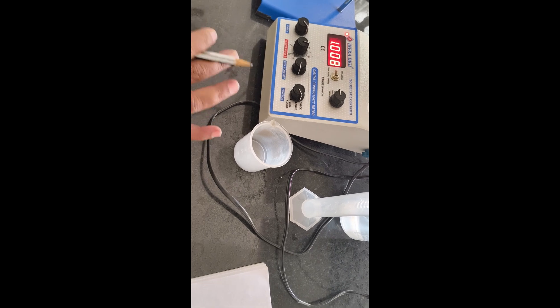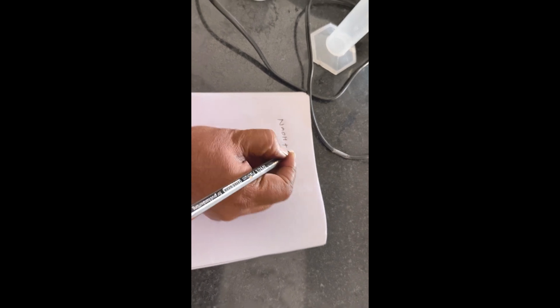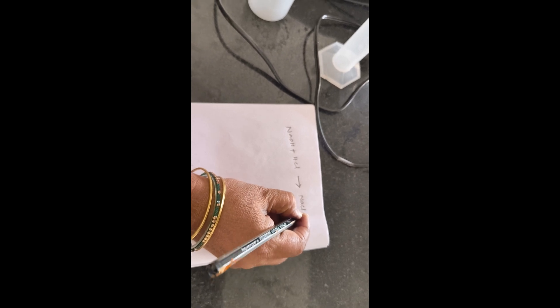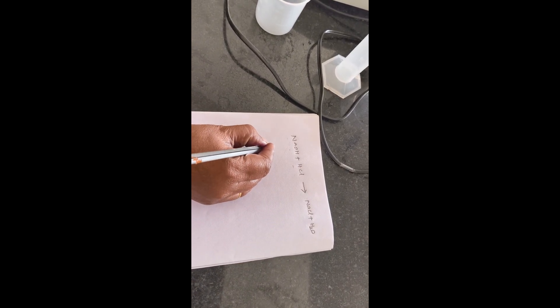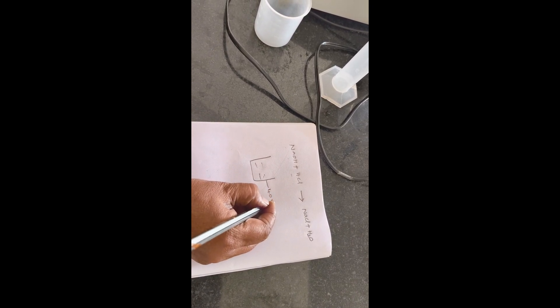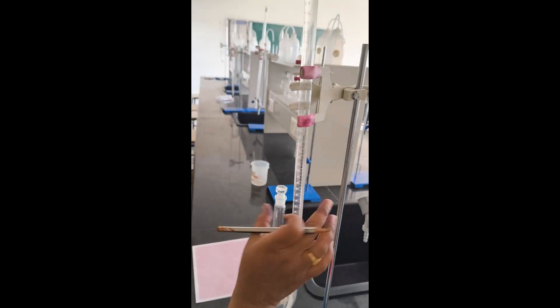Before going to the procedure, first we have to discuss about the principle. Let us consider the reaction: NaOH + HCl → NaCl + water. Here, NaOH is the strong base and HCl is the strong acid. We have to take 40 ml HCl solution in the beaker. In this beaker, we have to take 40 ml HCl solution and fill the burette with NaOH solution.